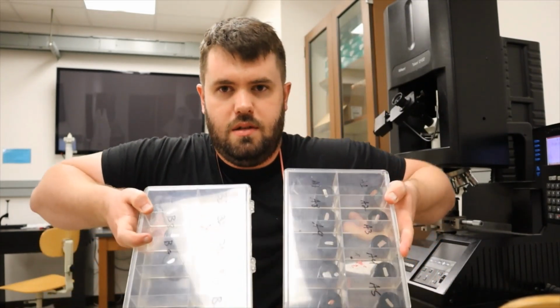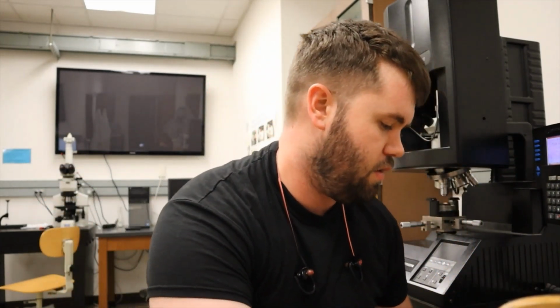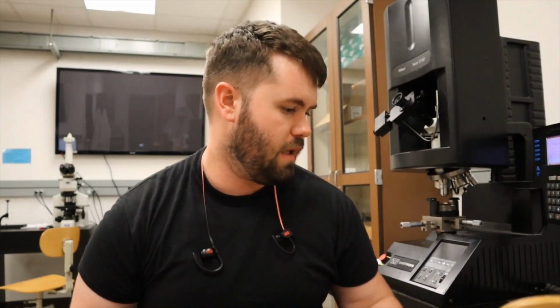either through substitutional or interstitial solution strengthening. So I'm just going to walk you through one indent on the Knoop indenter. It's going to look very familiar as the Vickers test. And then we're going to go to the microscope, and what we're going to do for the lab is we're going to give you a few different alloyed samples. So in these boxes here, you see we have a bunch of pre-prep samples, and each of these are labeled with a letter and a number, like A1 through A9 and B1 through B9.